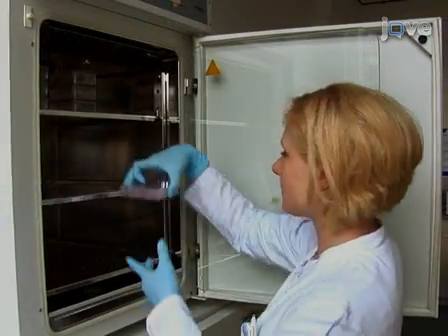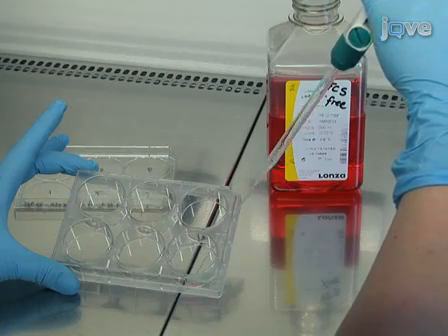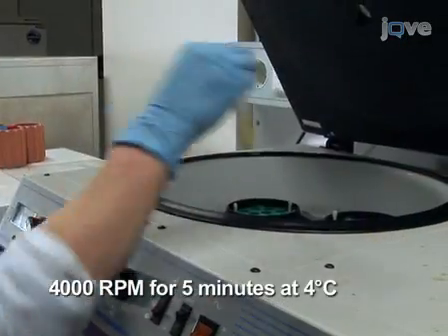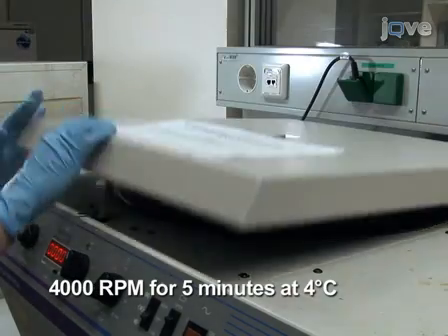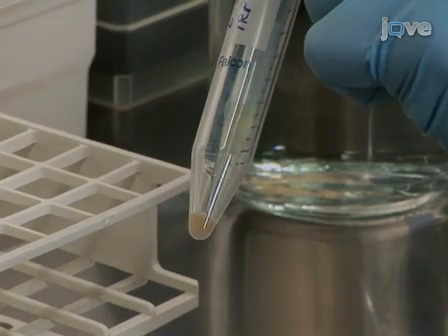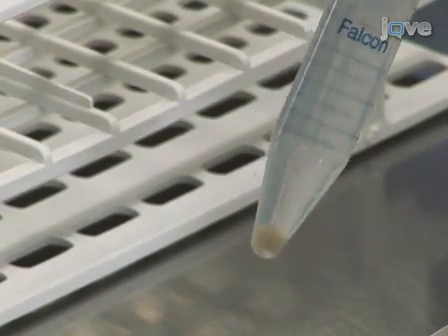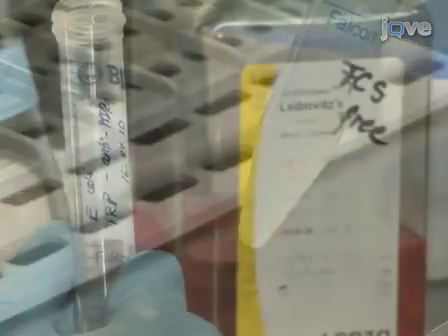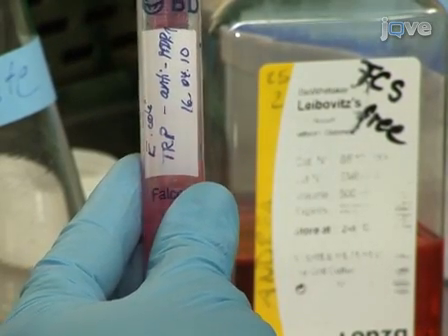30 minutes before the bacterial co-incubation, replace the FCS-containing cell culture medium of the carcinoma cells with FCS-free medium. During the 30 minutes period, wash the bacteria twice with 1 × PBS by centrifugation at 4000 rpm for 5 minutes at 4 degrees Celsius, and resuspend in serum-free Leibovitz L15 medium to the original diluted volume.